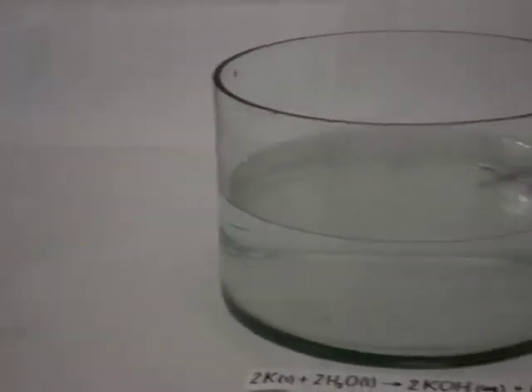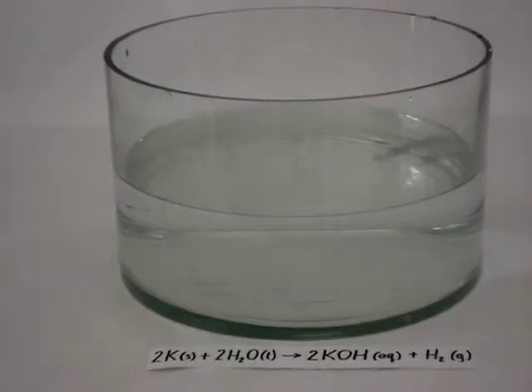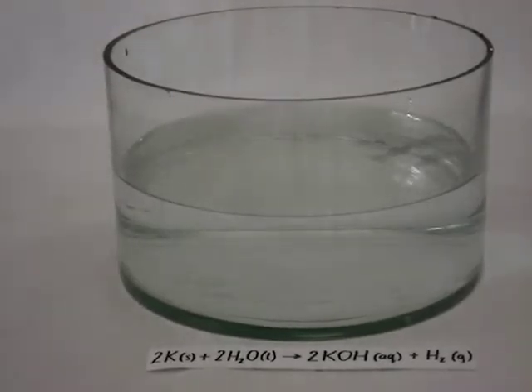Now we're going to add a little piece of potassium to water. We're going to see that the potassium is going to float on the water because all alkaline metals are less dense than water. It's going to react very violently.